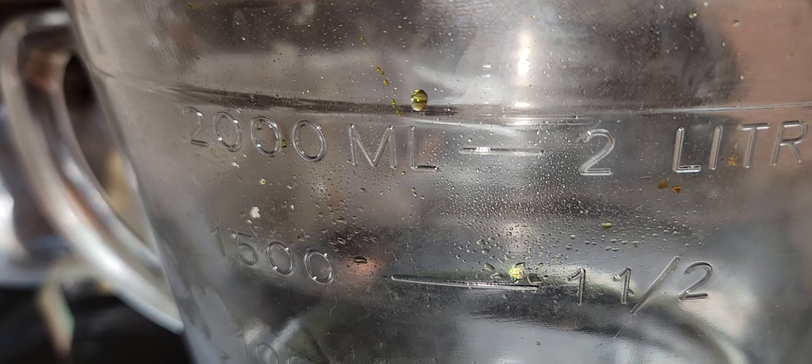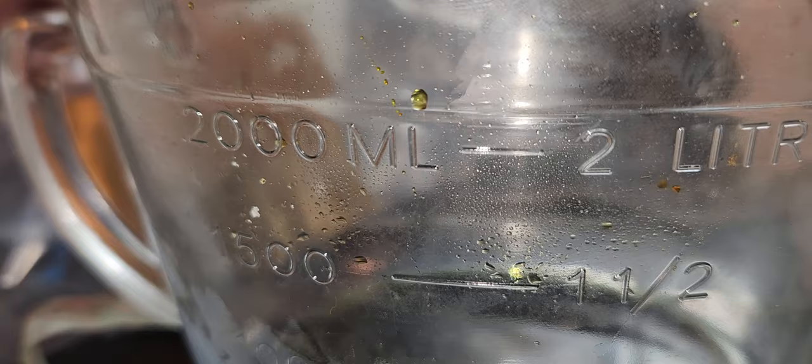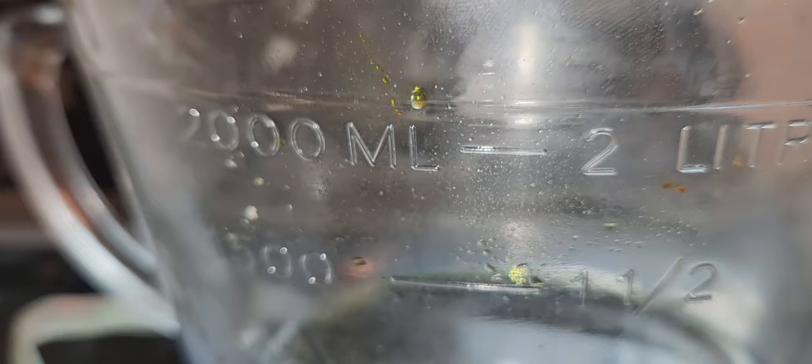This is a project. Can I plate bismuth onto brass sheets?